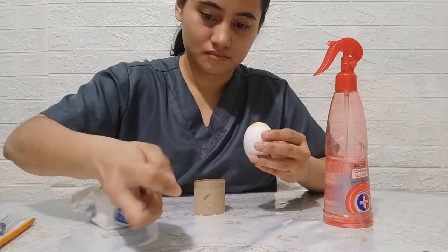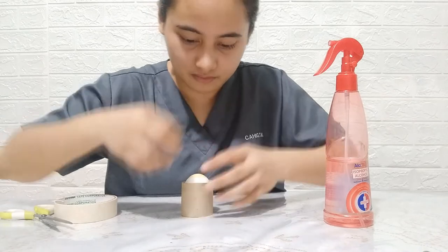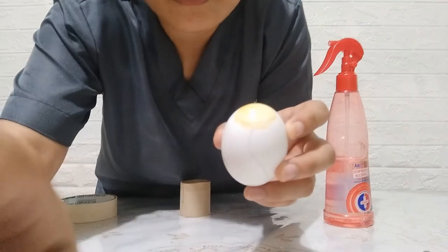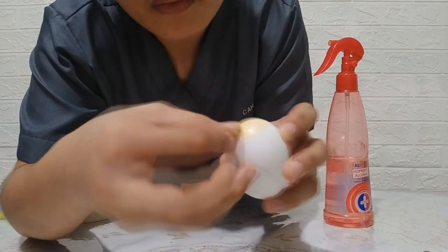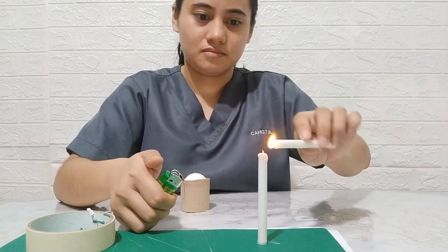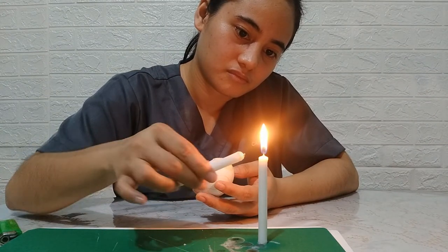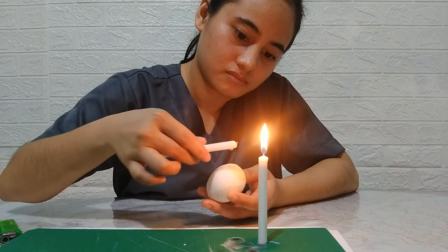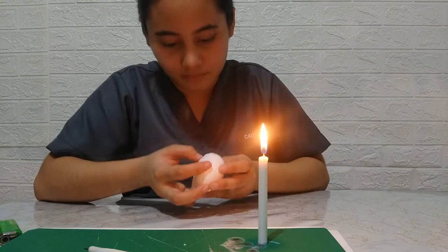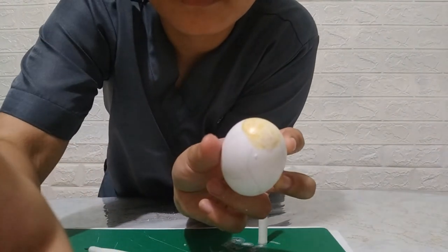Withdraw the needle from the egg. The hole in the shell is sealed first with a small masking tape. Light a candle with a lighter — the melted candle wax can double seal the hole. This guarantees security to the egg when it is placed inside an incubator afterwards to inoculate the virus properly.